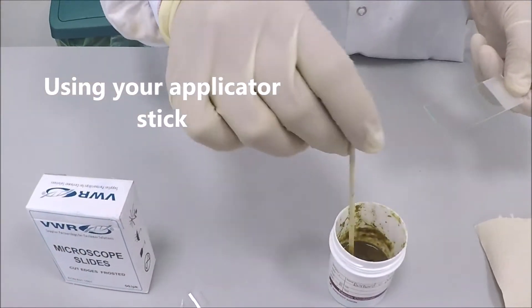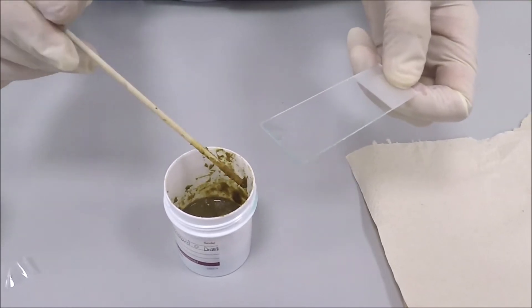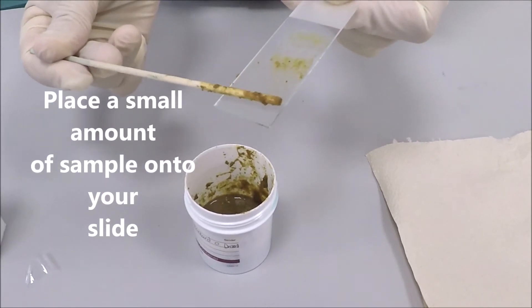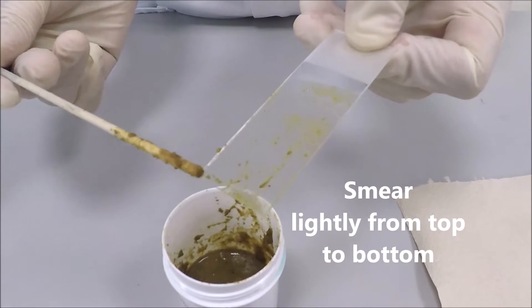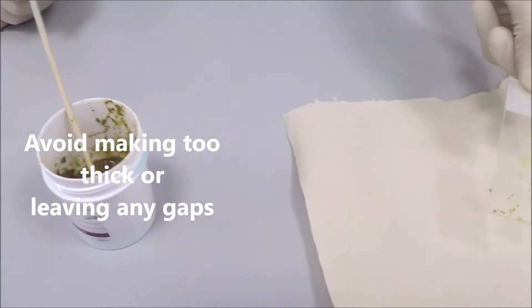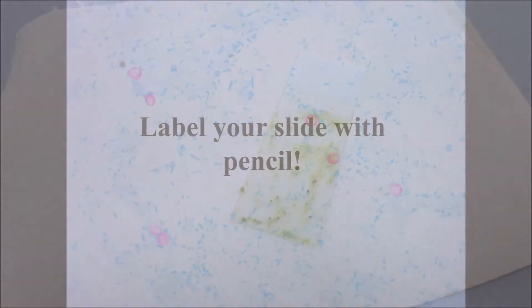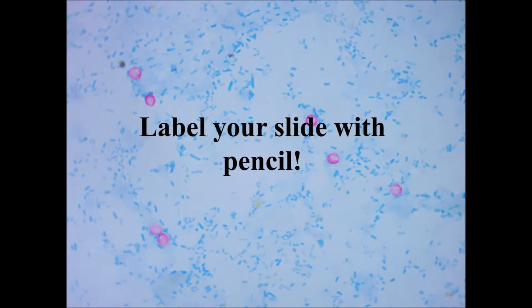Taking one microscope slide and using your applicator stick, smear your faecal sample from top to bottom of your slide. Make sure it is not too thick or that there are many gaps. Allow your smear to dry before staining. Please remember to label your slide with pencil for ID purposes.